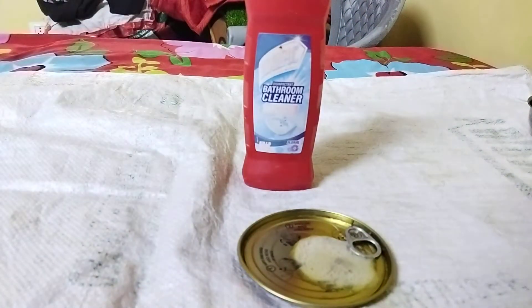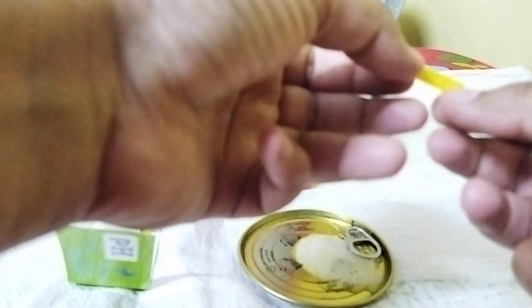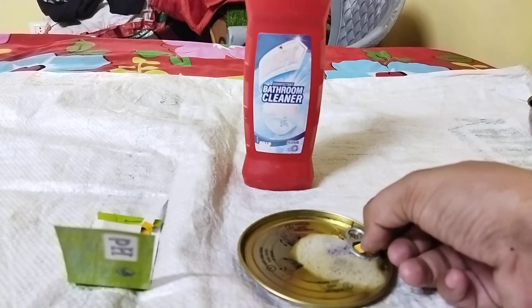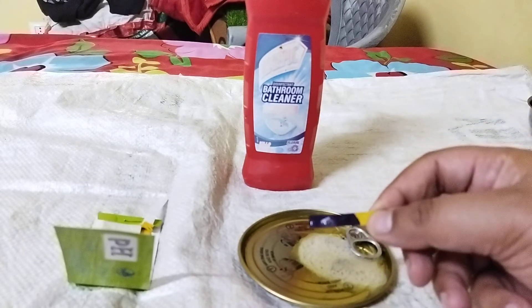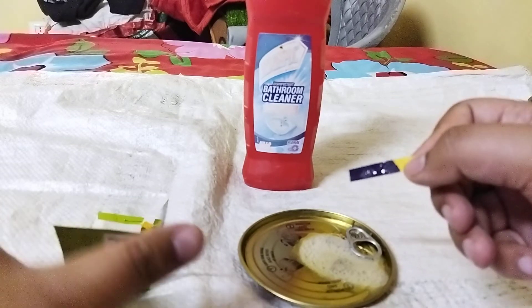One more thing to add — it is also having a floral flavor, so you may be having a different flavor and the pH may vary in that case. So let me quickly pull out a strip of the pH paper.